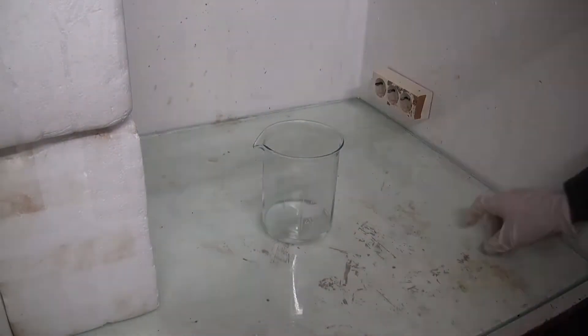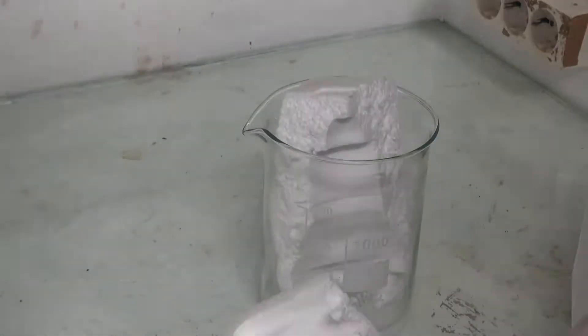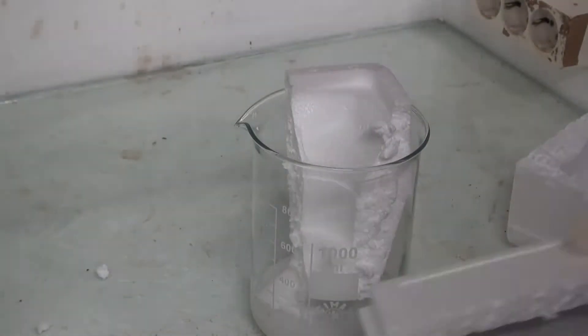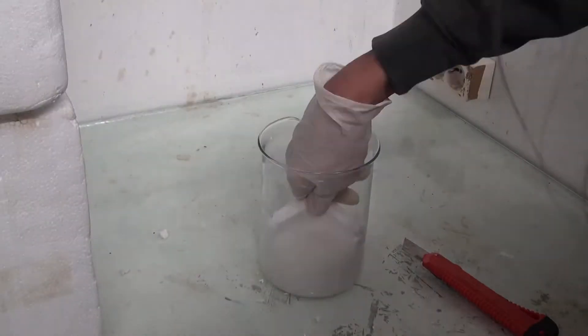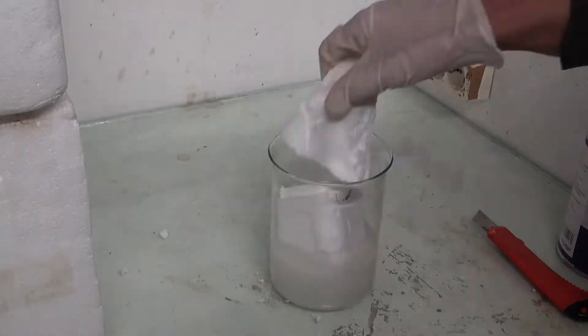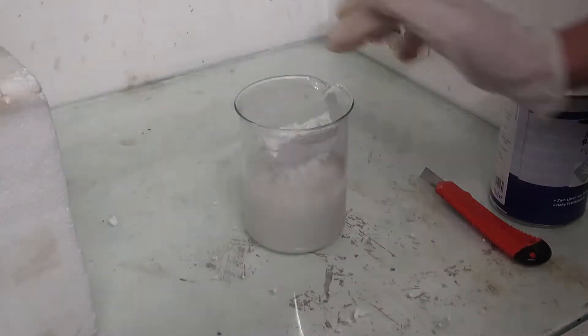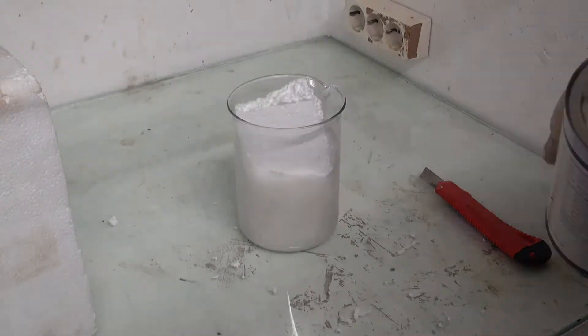I started by reducing the volume of some styrofoam shipping boxes that were left over from my unboxing video. This step was very important because nearly 99% of it is air. There are a few ways to do that.